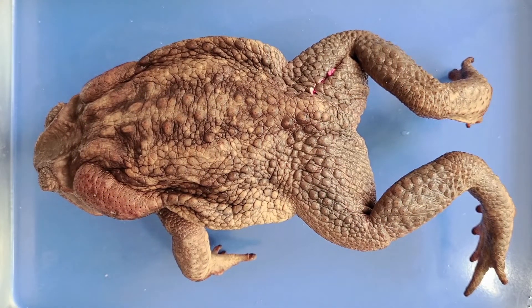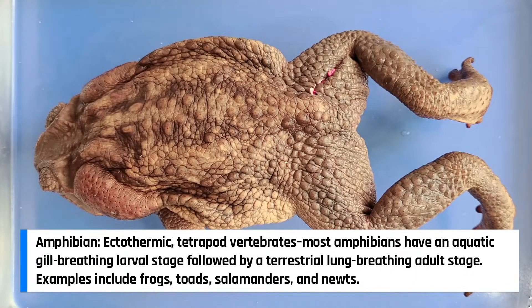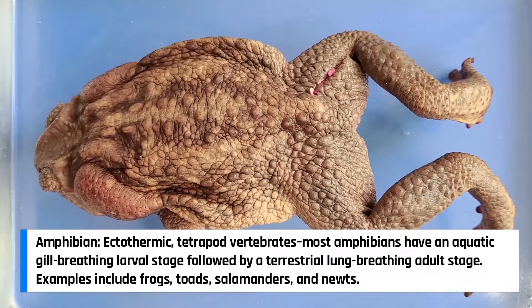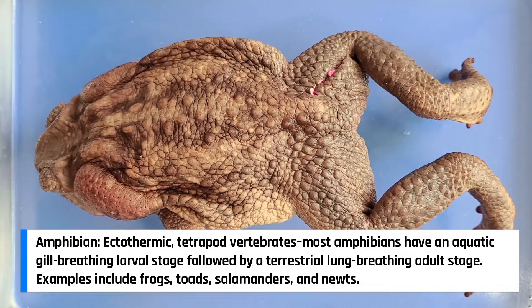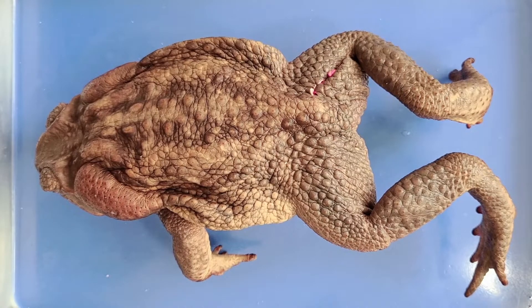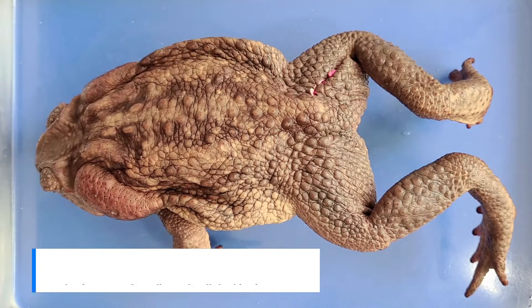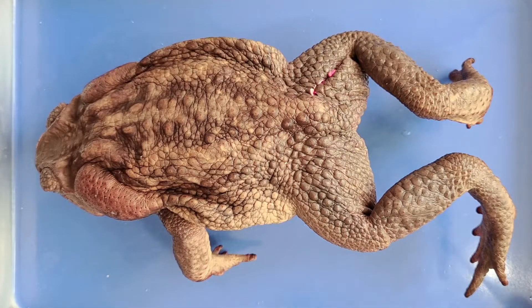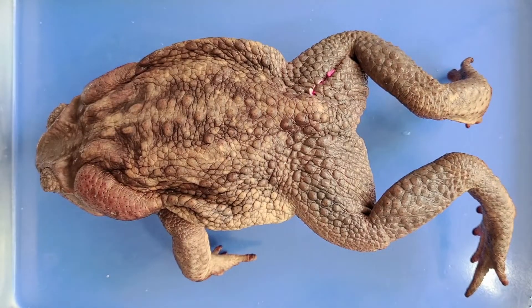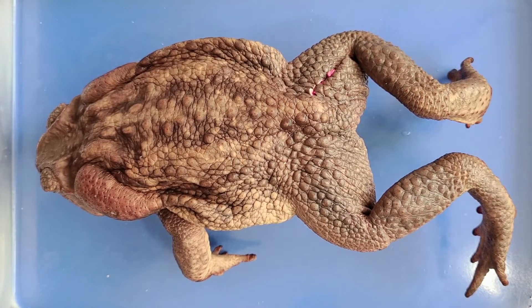Hello and welcome. Today we'll be taking a look at the anatomy of a toad. Toads are amphibians just like frogs. The word amphibian derives from the Greek 'amphibios,' meaning living a double life. Toads and frogs live in both land and water, although there are a few differences — most frogs have long legs for jumping and smooth mucus skins, while toads generally have shorter legs for walking and rougher, thicker skins. However, both frogs and toads share many similarities that help them adapt to both land and water.